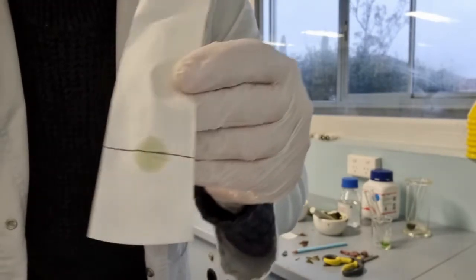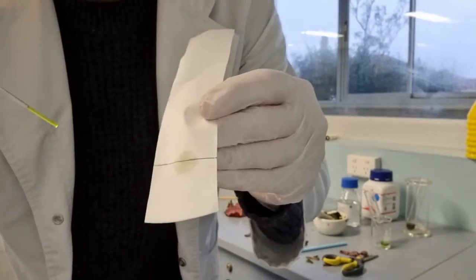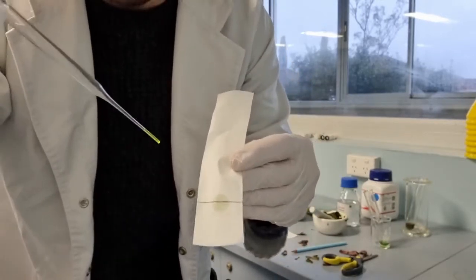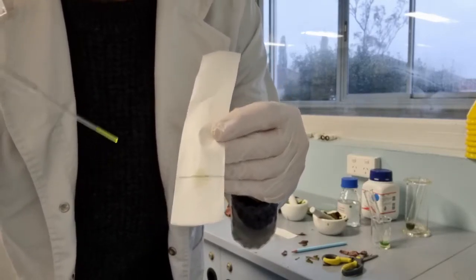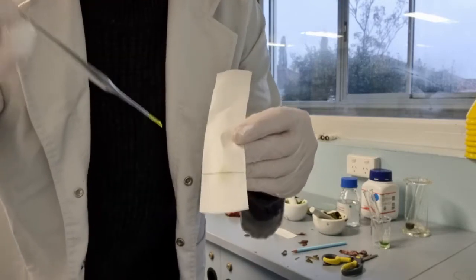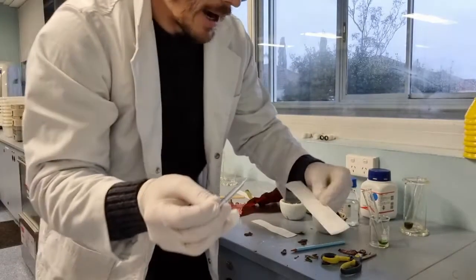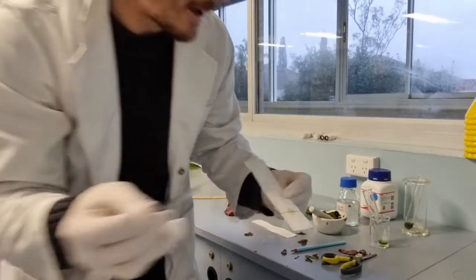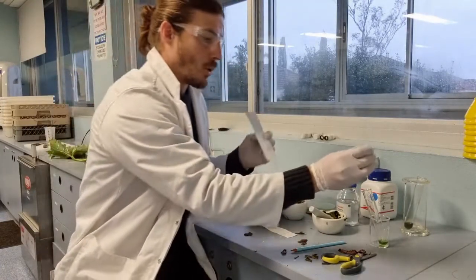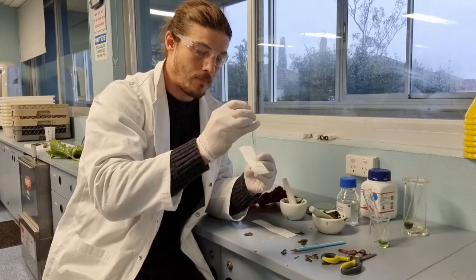Okay, now I can see that was massive. I really don't want this. Every time I dab one on, it's going to get bigger and bigger, and I don't want that. So I'm going to wait for it to dry, then I'm going to dab on another one. Wait for it to dry, put on more. I really want that dot to become super concentrated with my chlorophyll, so I need to do this over and over. Luckily, acetone is incredibly volatile. It evaporates in no time at all, and we end up with a really quick dry. So I can just keep doing that over and over, but I'm not going to bore you making you watch that, so just take my word that I am.